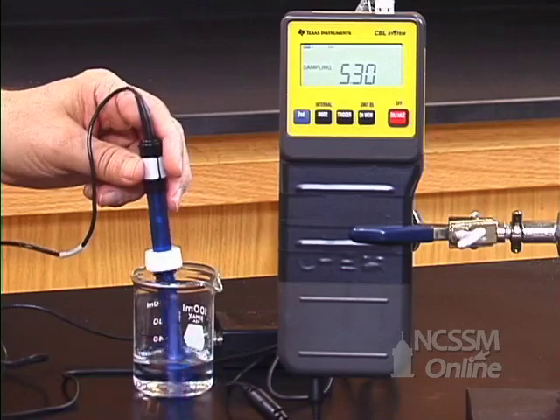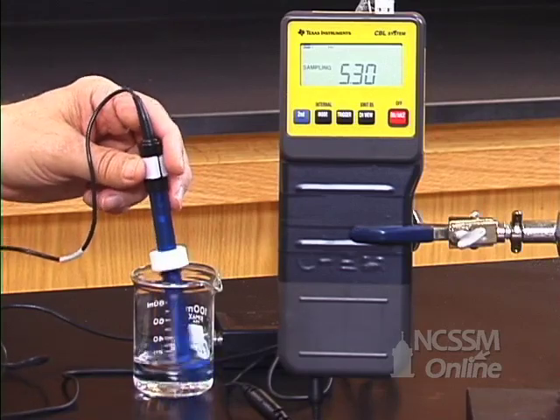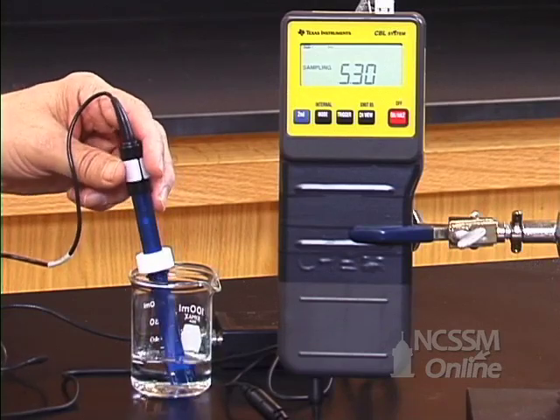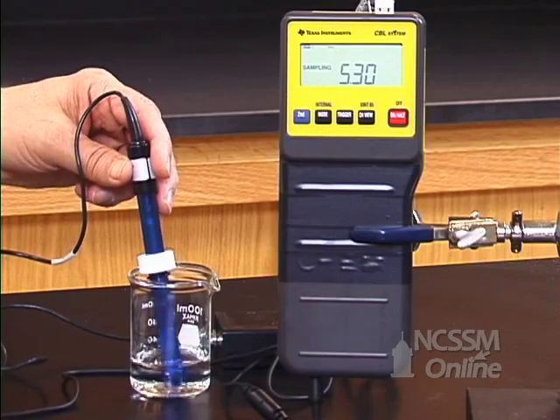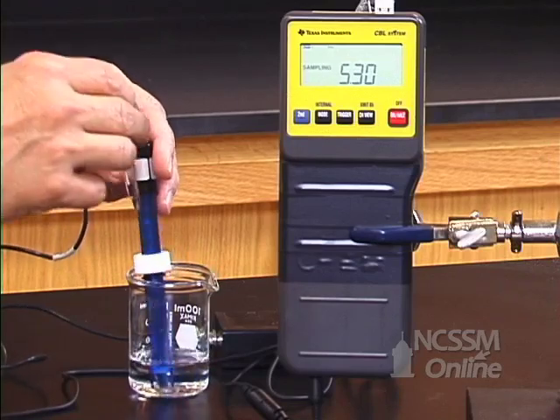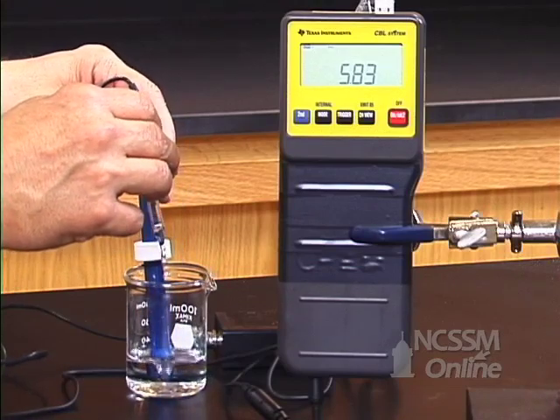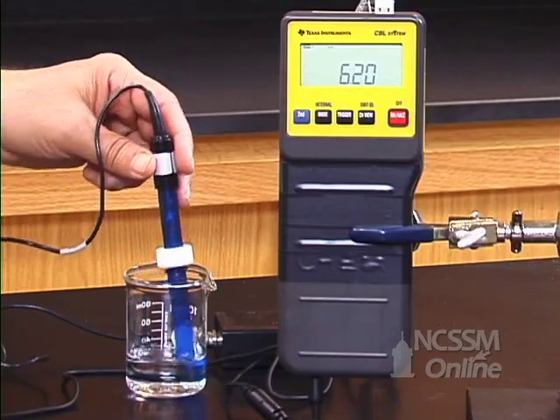After 20 drops, it's up to 5.3. It will maintain relatively constant pH until I add enough sodium hydroxide to use up all the weak acid. After about 45 drops, the pH is starting to rise more rapidly.